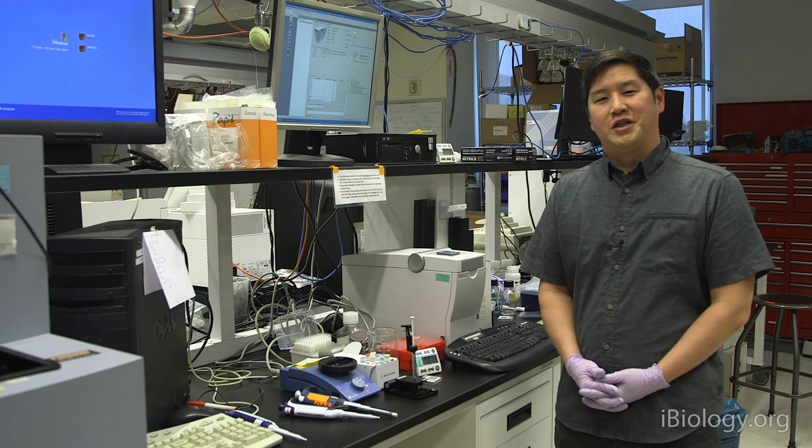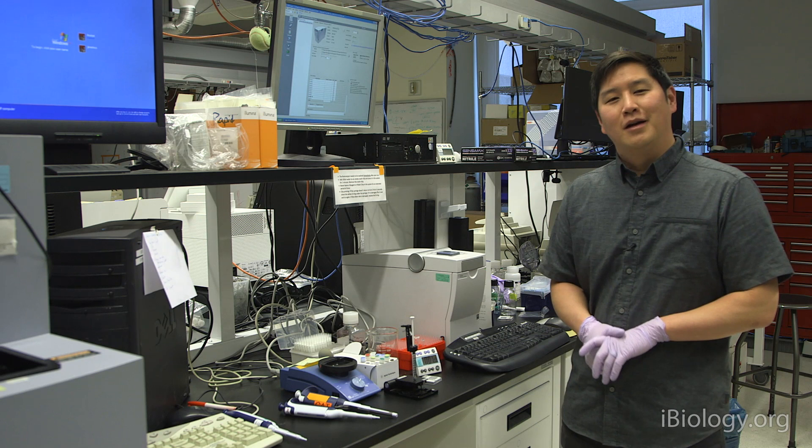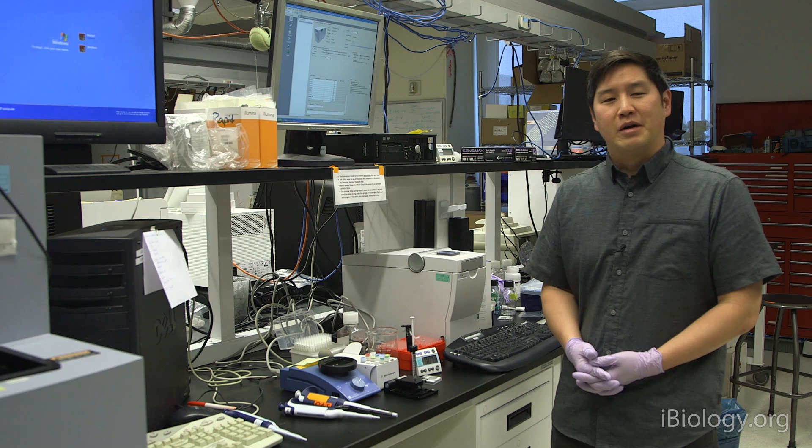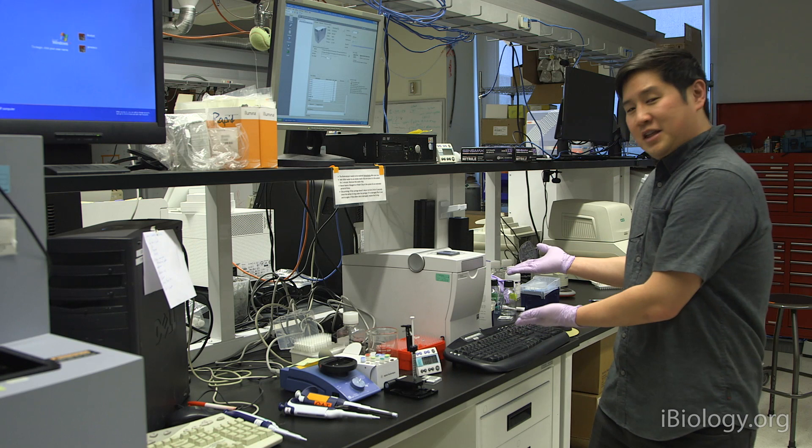Hello, my name is Eric Chow, and I direct the UCSF Center for Advanced Technology. Today, I'm going to give you a training video on how to operate the Agilent Bioanalyzer. This is the system used to QC nucleic acids to go into next-generation sequencing library preps, as well as checking the quality of your final libraries for sequencing.